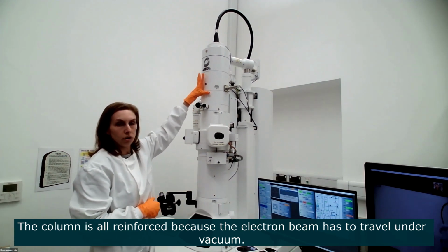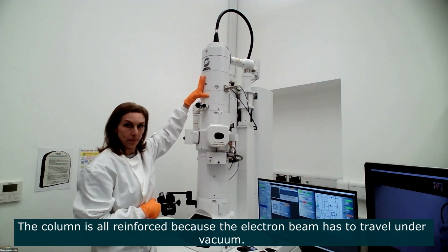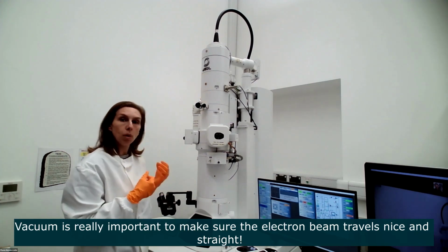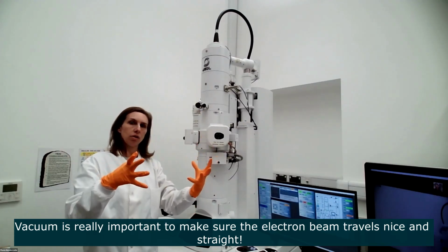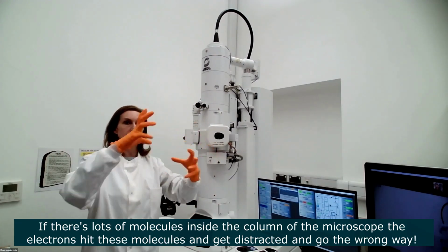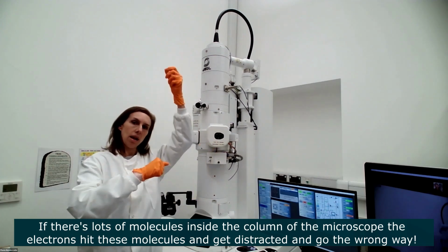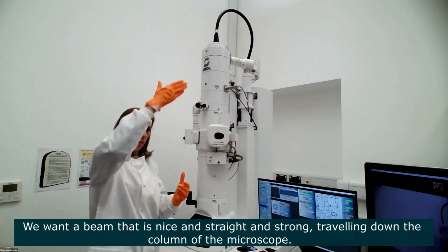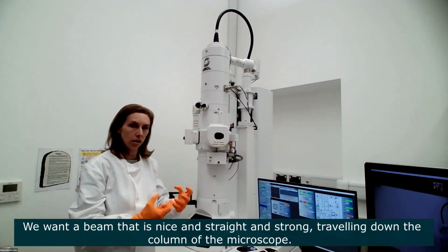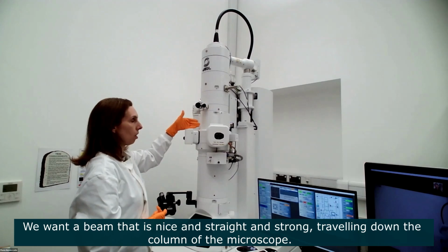And the column is reinforced because it's all under vacuum. The vacuum is really important to make sure that the beam travels nice and straight, because if you have lots of atoms inside the column of the microscope, the electrons will hit all these atoms and will get distracted, go the wrong way. We want a beam that's nice and straight and strong, traveling down the column of the microscope.